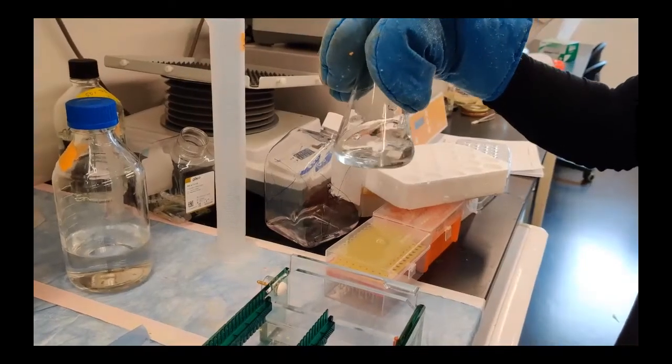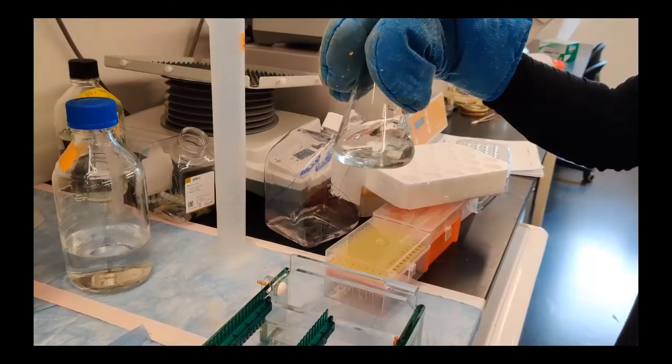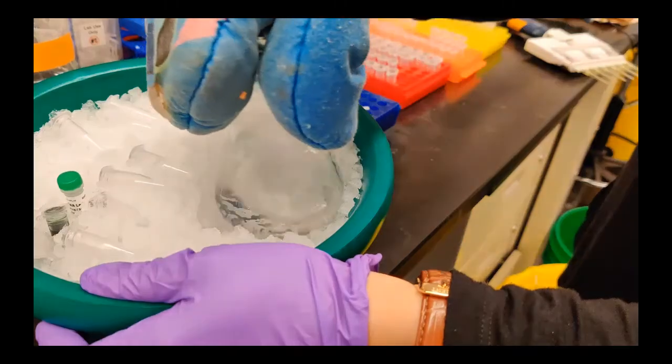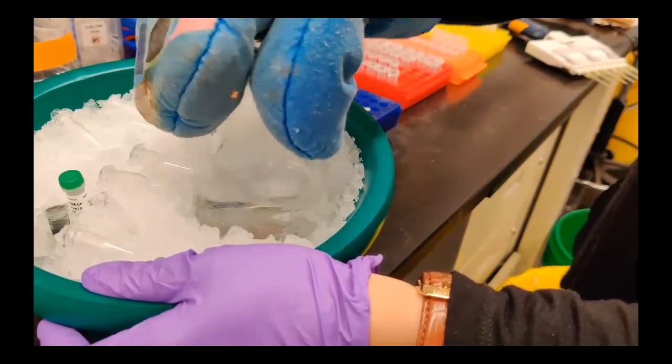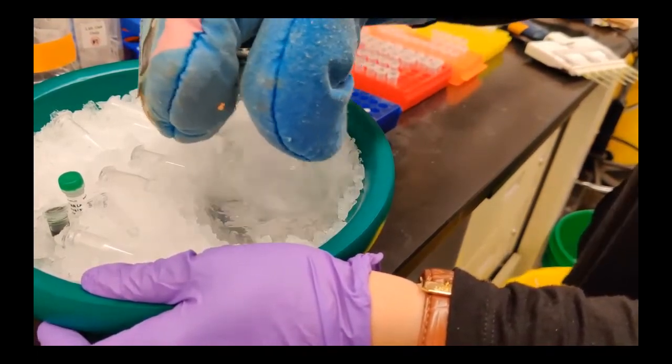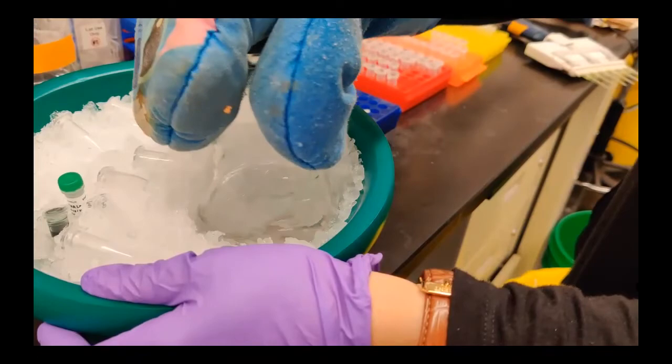The microwave timer is up! Can you still see the powder? If not, perfect! Since it is super hot, we have to cool it down a little bit by swirling it on ice.